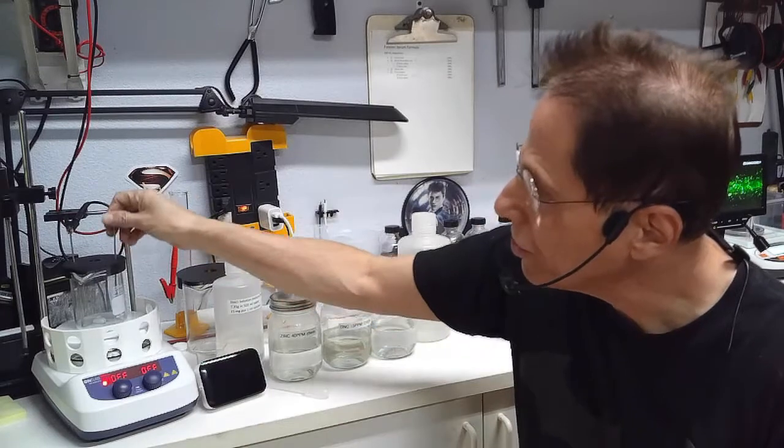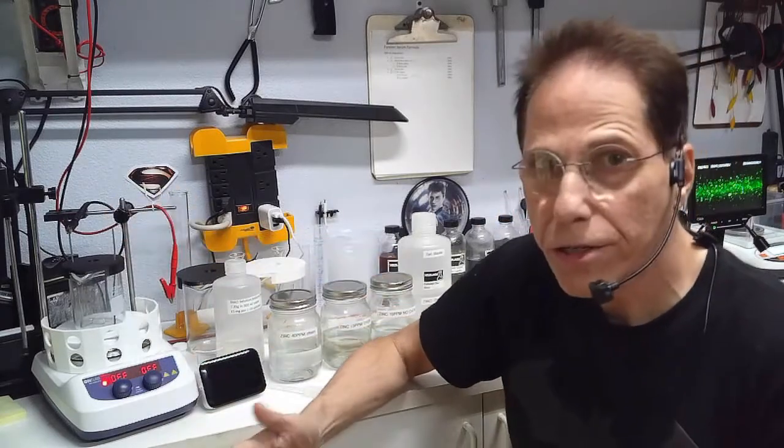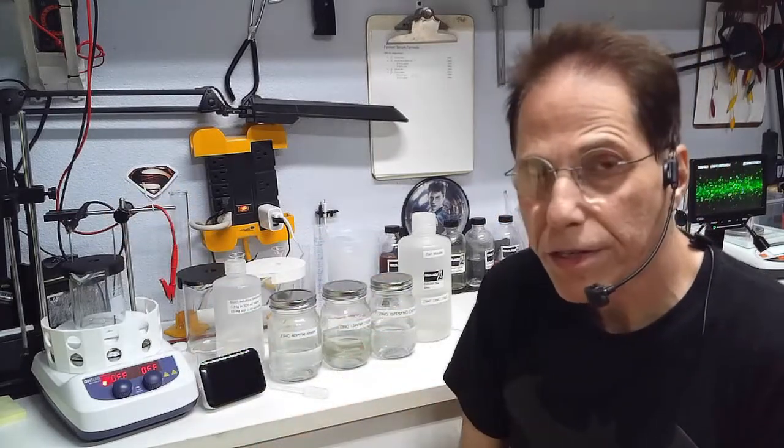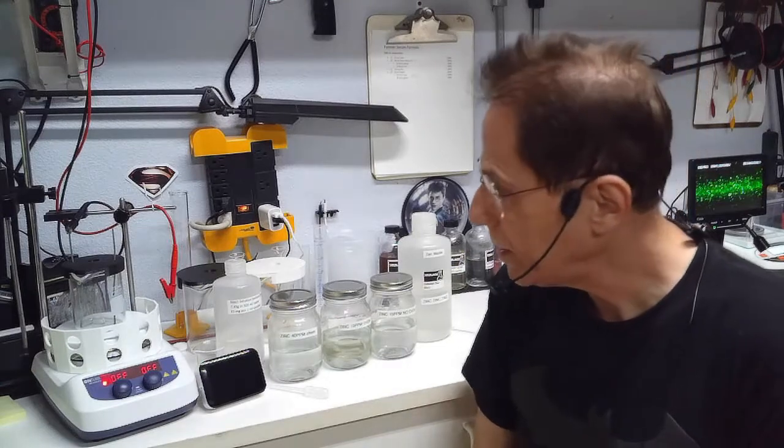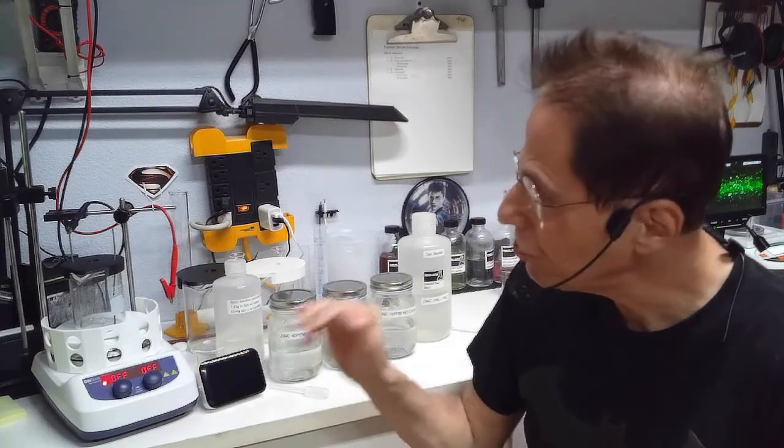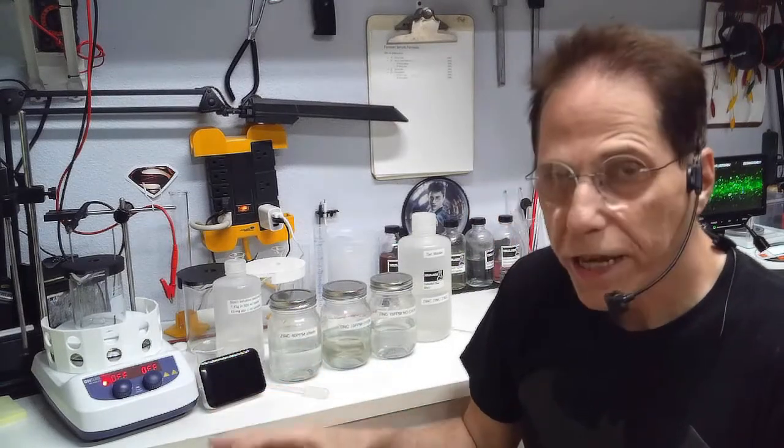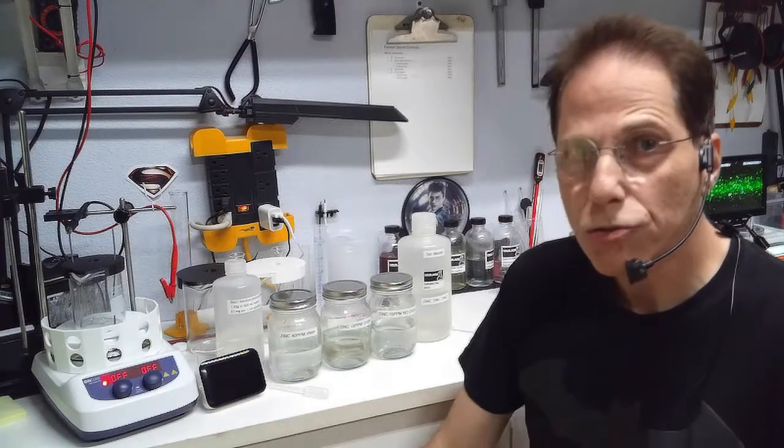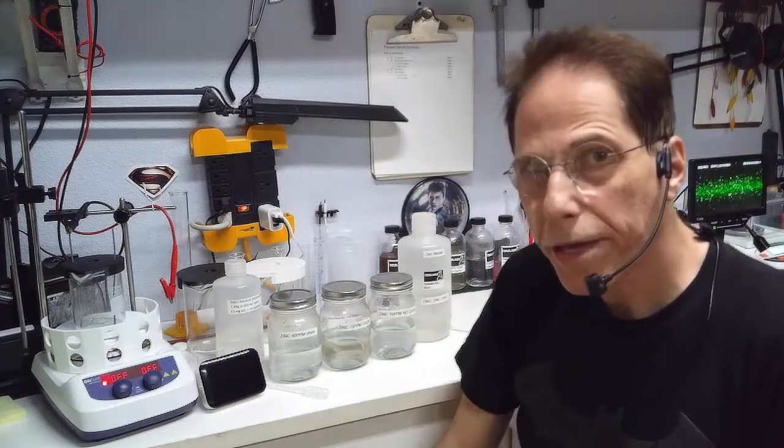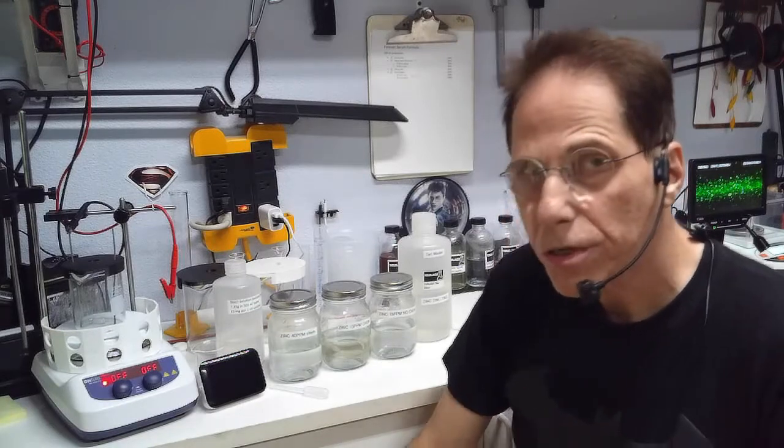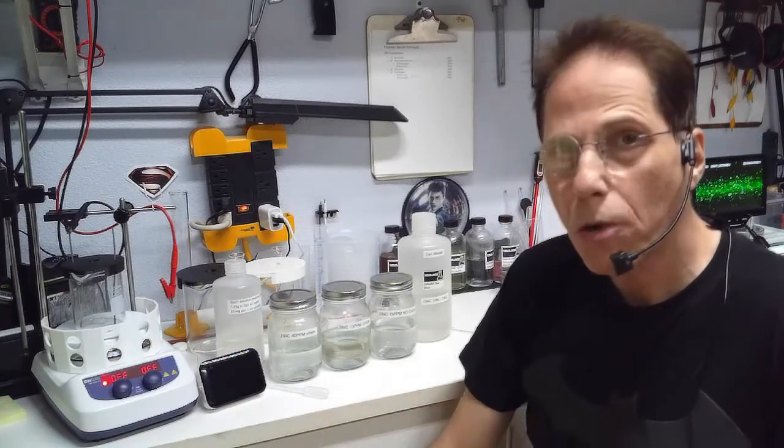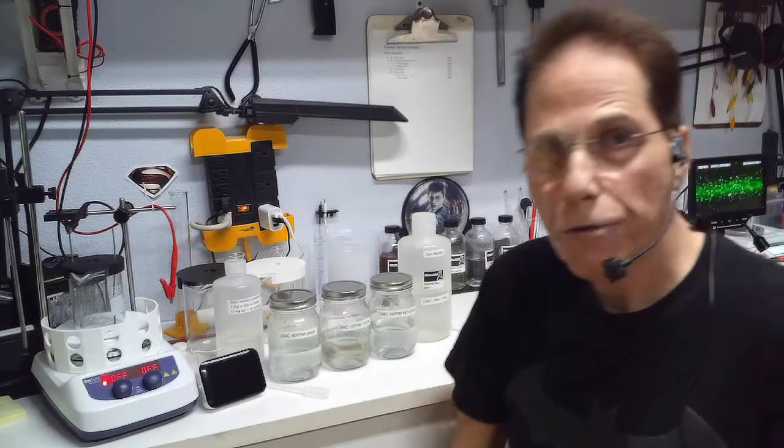So I've tried to make this as simple as possible for you, so don't use any heat. It's going to take longer but at least you'll know what's in there. And the tricky part of the zinc, the extra that makes it a little bit harder, is you're going to need a current meter, something that's going to measure in the milliamp range down to one milliamp.